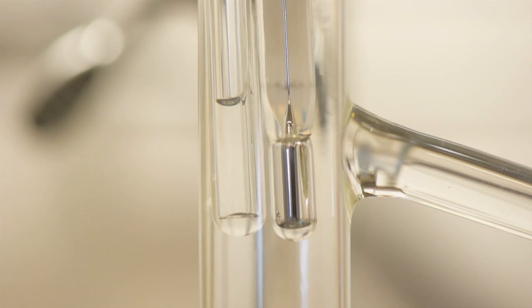As you are heating the system, watch the bottom of the bell tube. You will be looking for bubbles to evolve from the bottom of the bell tube. This will signify the point at which the pressure in the bell tube is greater than the atmospheric pressure, which is due to the sample boiling.